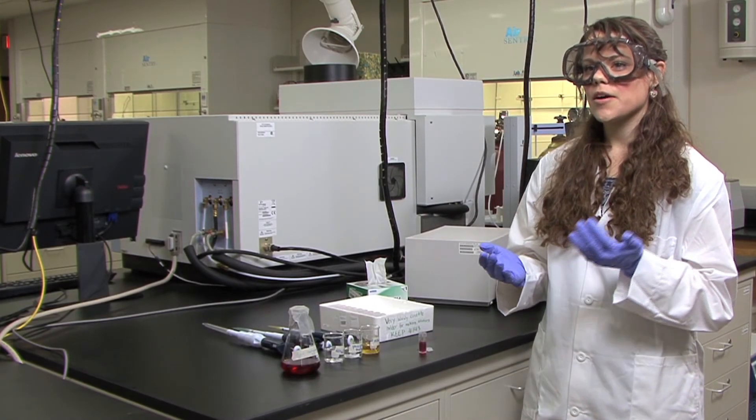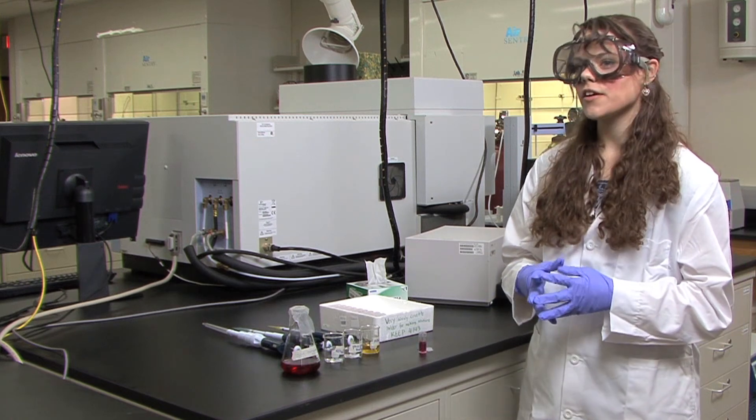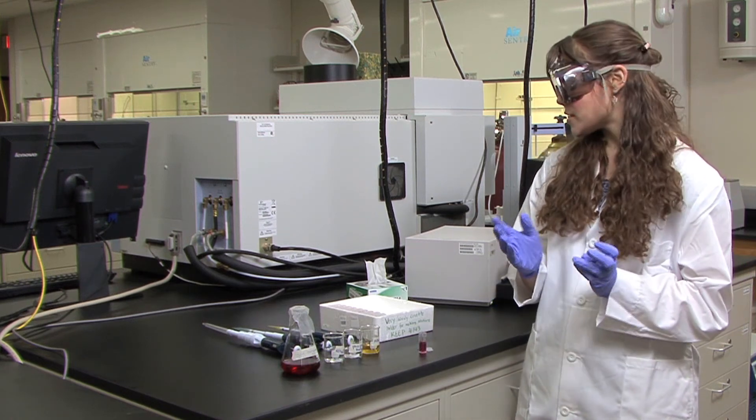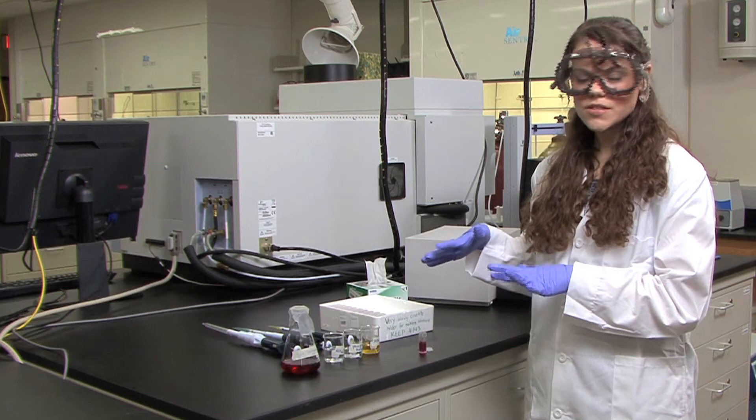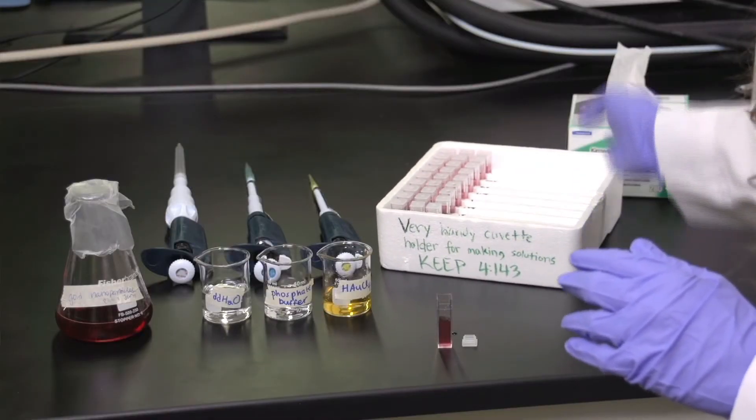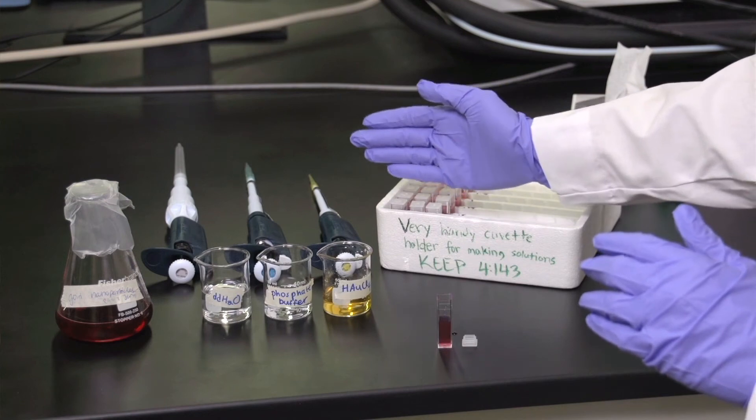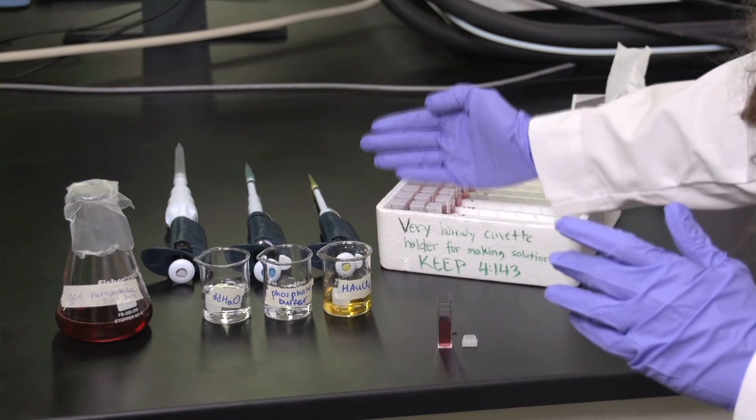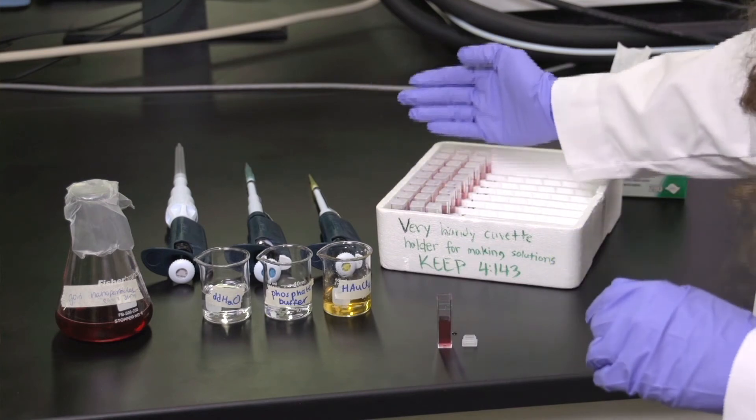Once you are done collecting the blank spectrum and the synthesized nanoparticles spectrum, you can prepare the rest of your solutions. It is really handy to use this cuvette holder for all of your solutions, and you can just label them with the appropriate hydrogen peroxide concentrations.